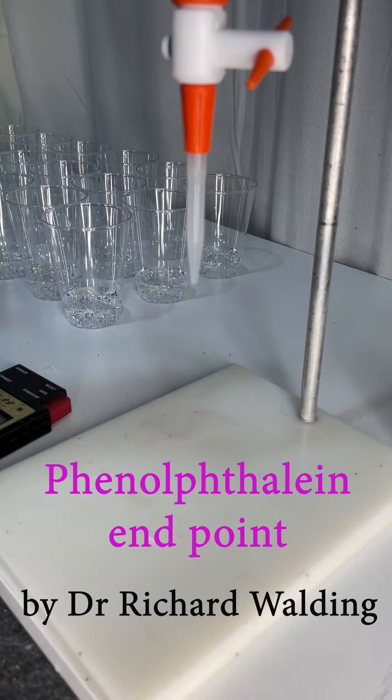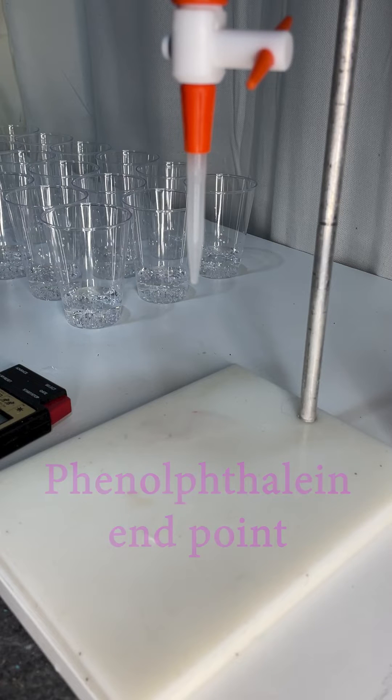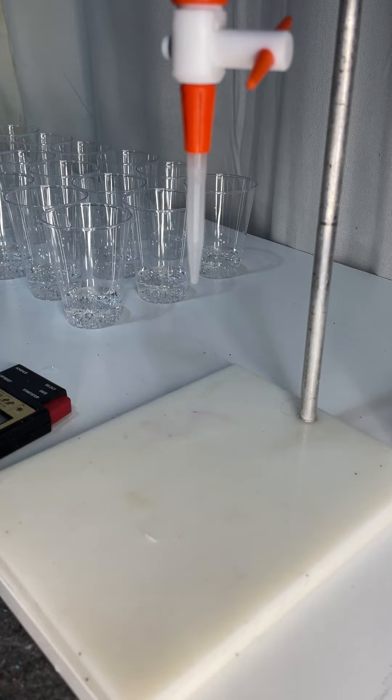Hi, Richard Walding here. I'm just going to show you what the endpoint looks like using phenolphthalein for an acid-base titration.